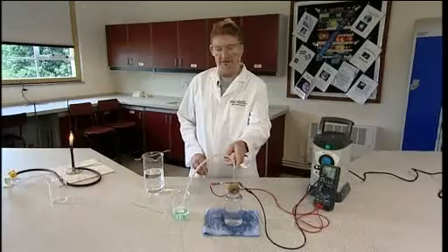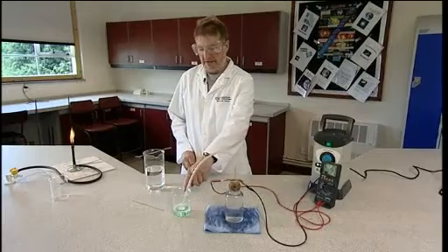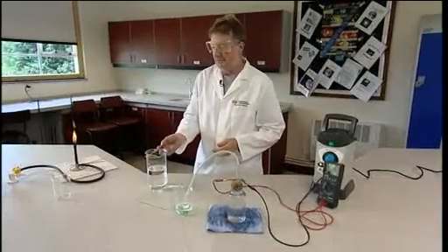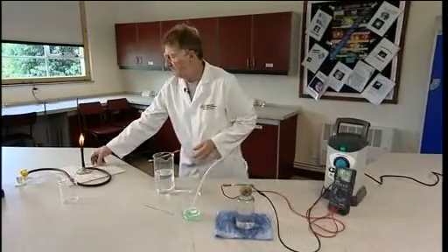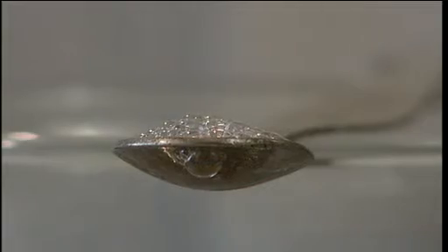It will take a couple of minutes for the hydrogen and oxygen mixture to displace air from the delivery tube. But after that, you can take a scoop of the bubbles in a small spatula or a spoon and ignite these with a lighted paper.